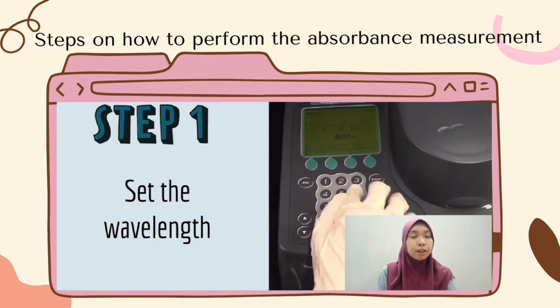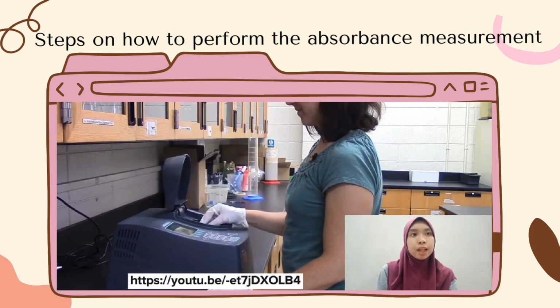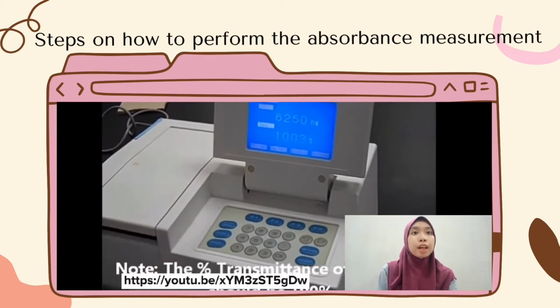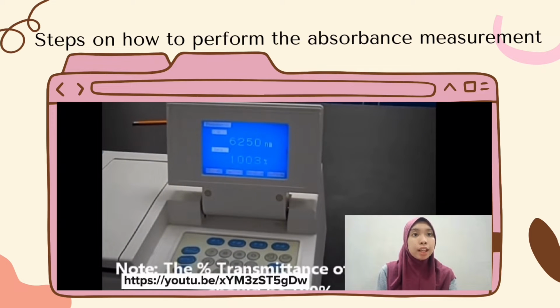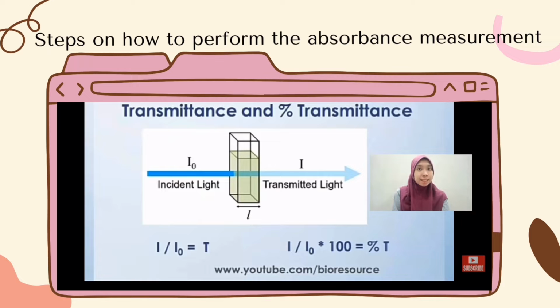Next, before the experiment starts, the wavelength should be set to analyze the sample. In this experiment, the wavelength has been set to 625 nanometers. After that, the value of transmittance will be measured for each tube. Next, the transmittance is found by dividing the transmitted light or the output by the incident light, which is the input. This varies as a function of the sample concentration.